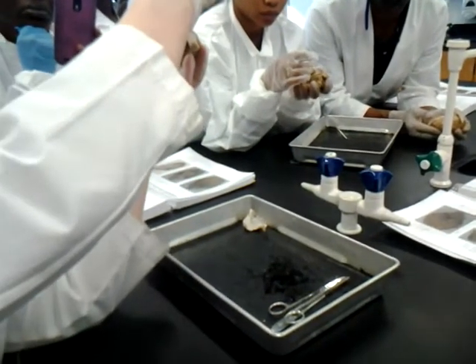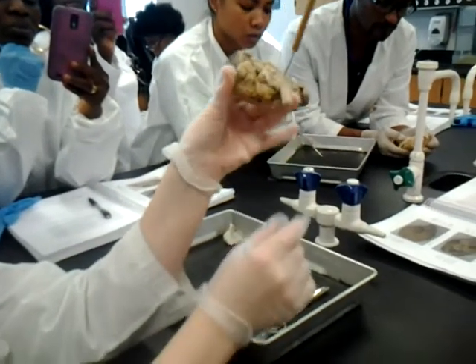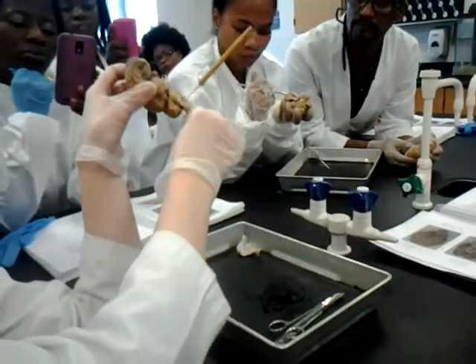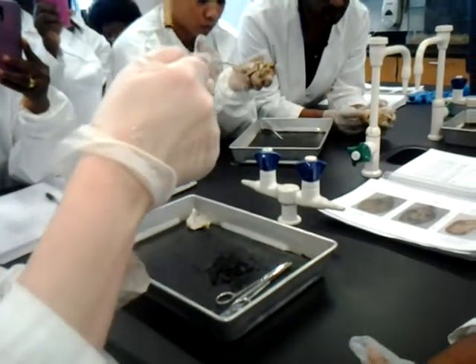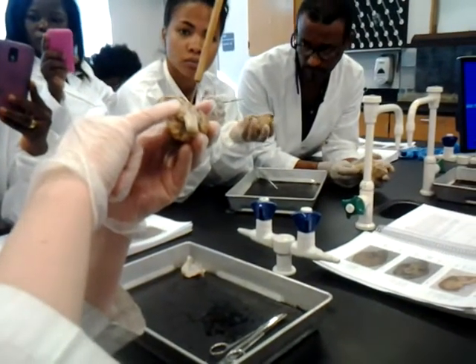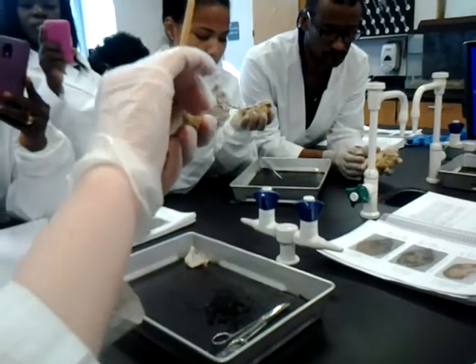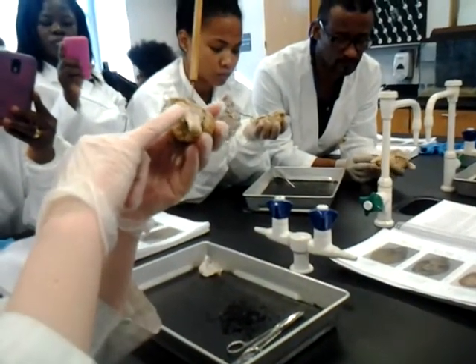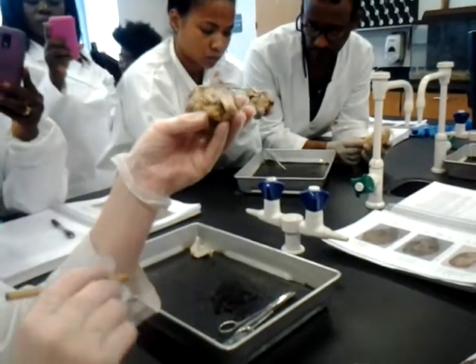And then down from that is the medulla oblongata. Now, coming off of that is the spinal cord. If you notice, the spinal cord is much thinner than the medulla oblongata. Even though the medulla oblongata connects to it, you can actually see where the spinal cord starts because it's a lot smaller. The medulla oblongata is thicker, closer to the size of the pons in this case.